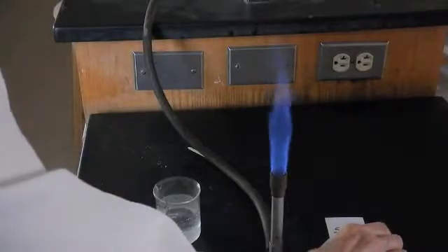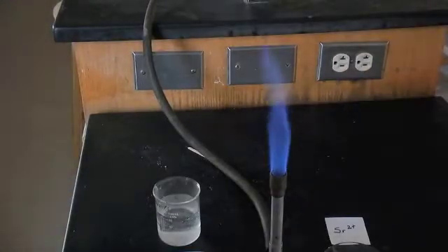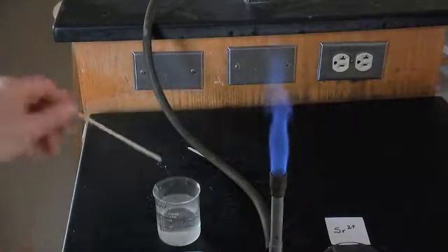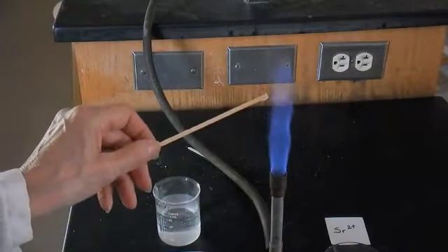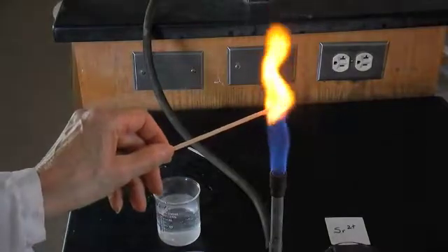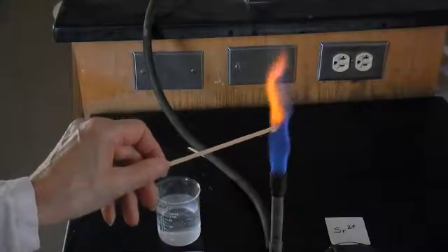Going on to strontium. I take it out of the flame if the wood's going to burn—that has its own particular color, of course. So here's strontium—you can just about see the colors that are different from the flame.